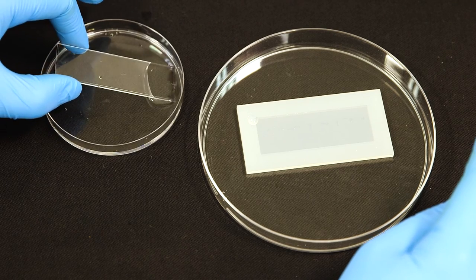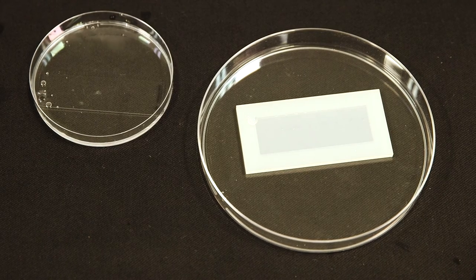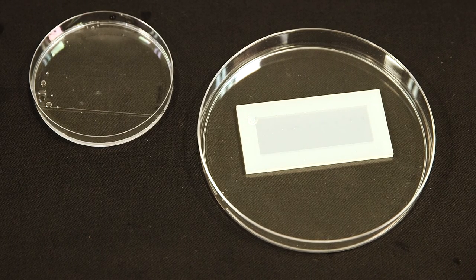Turn the chip gel side up, again being careful not to touch the gel with your gloves, and return it to a clean petri dish containing wash buffer.